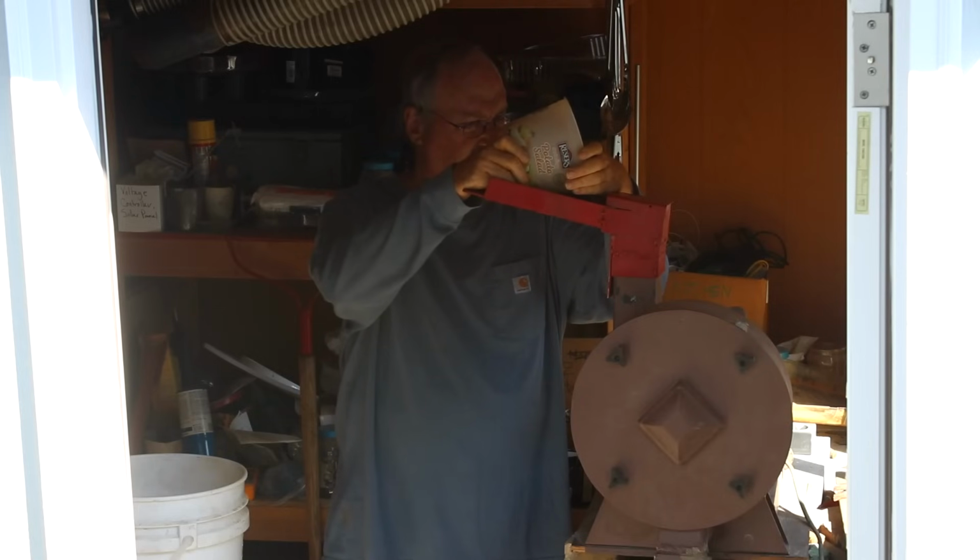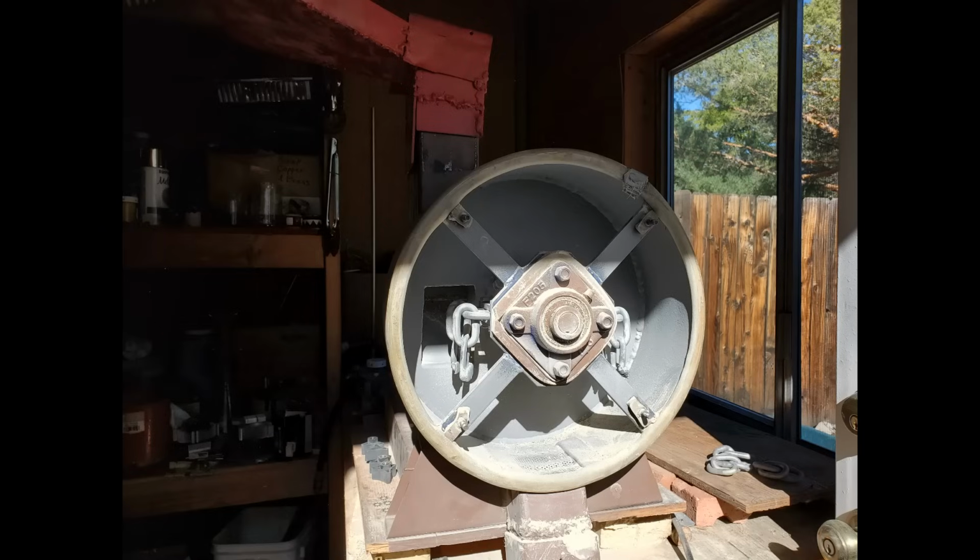So here, let me show you a little bit more detail about how this thing works. A couple of photos will explain how the chain mill works. So here's what the inside of the chain mill looks like. The material comes in on the left, that square hole, and then the chains spin around so fast the material gets smashed against the walls of the crusher.